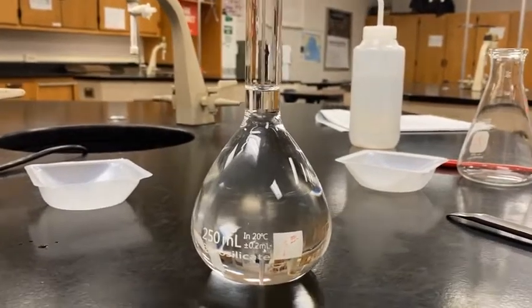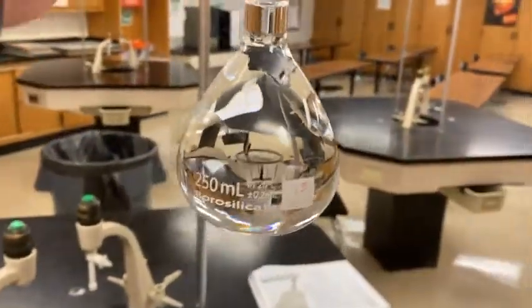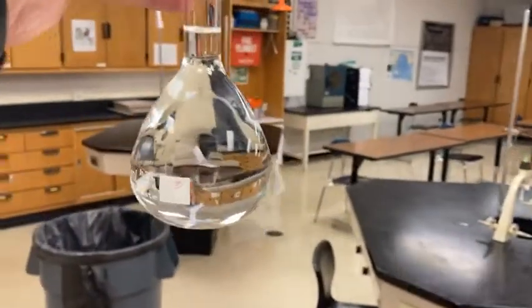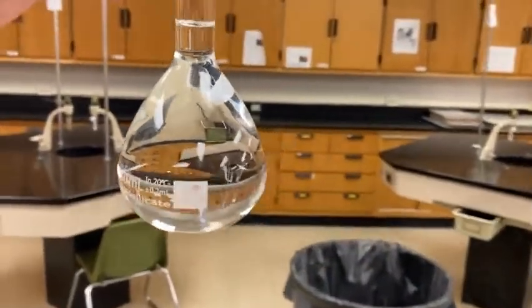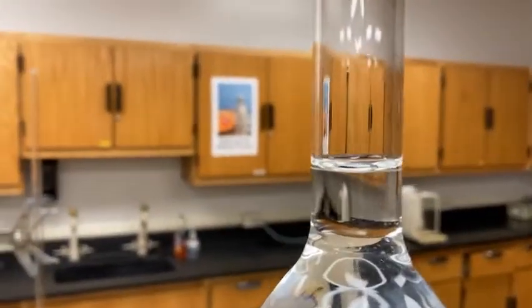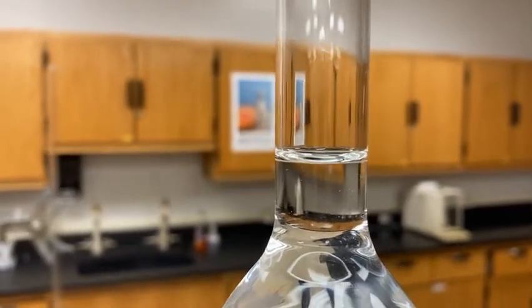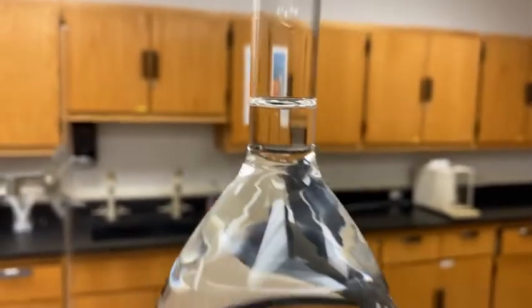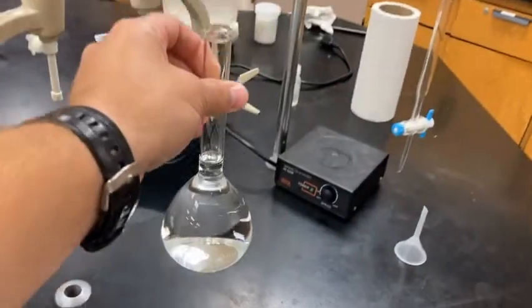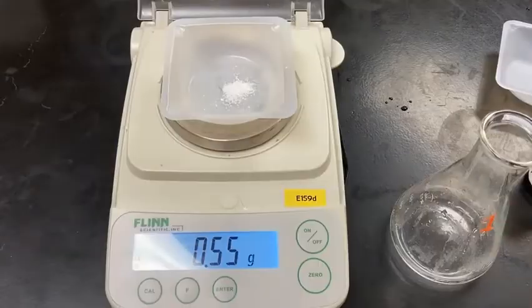which we are now going to titrate to see what the concentration is, if it really is 0.10 molar. If, when I was adding the sodium hydroxide, some of it didn't get in, I don't think I did, that would make the concentration a little bit less. Or if the meniscus was a little bit above the line in the flask, it could also be a little bit more diluted. So we want to get the exact concentration of this solution, and that's what we're going to use the KHP for in our next step.